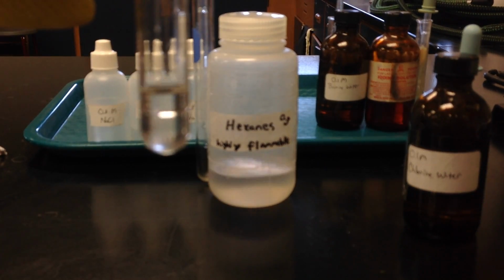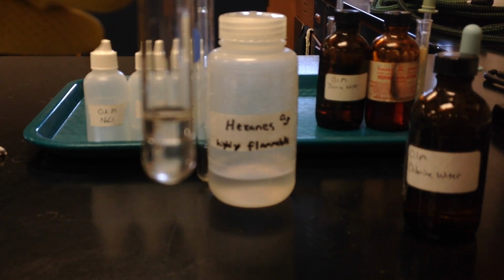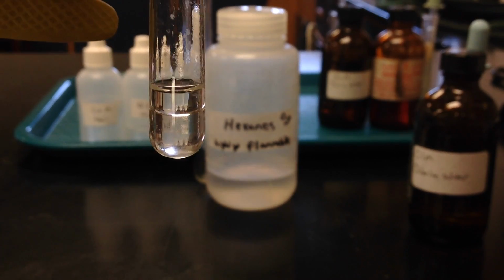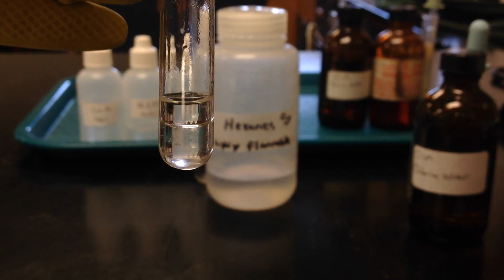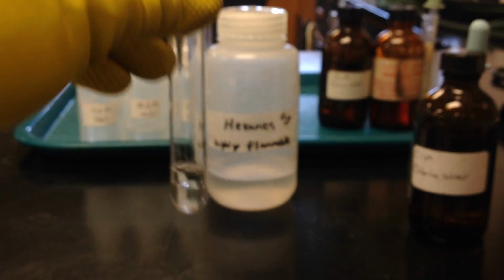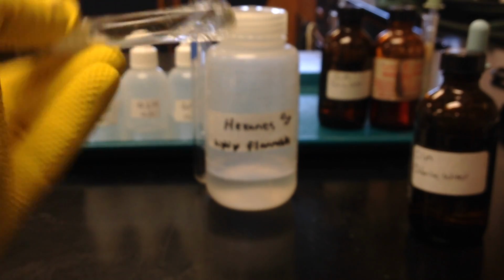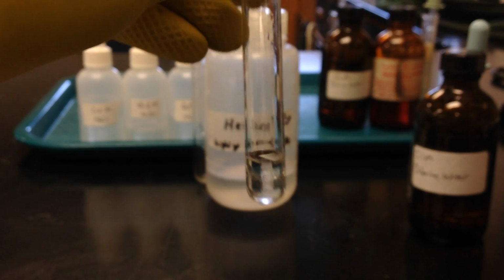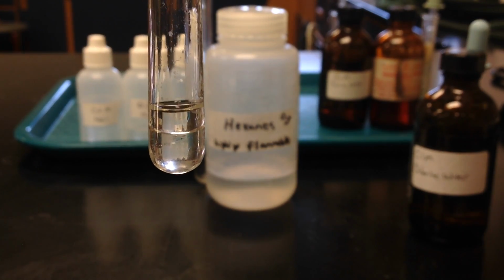So if you look at the test tube, you should be able to see those different layers. Again, it's the hexane layer which is on top, and the chlorine water is what is on bottom. I'm going to cap the test tube and gently invert that, shake it to get that chlorine to go up into the hexane layer. And now when you take a look at that top layer, you want to write down its appearance.